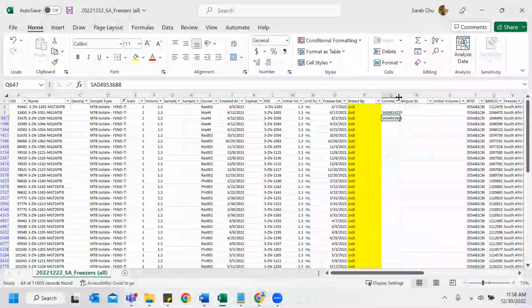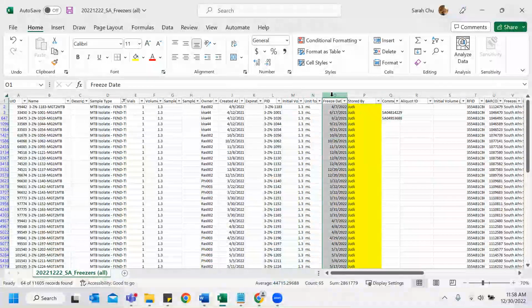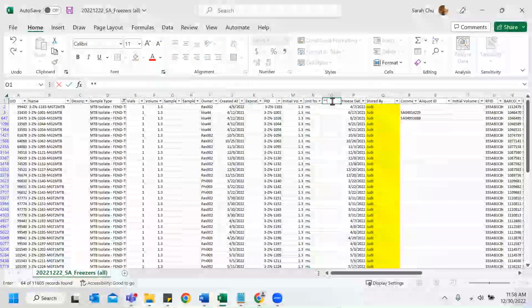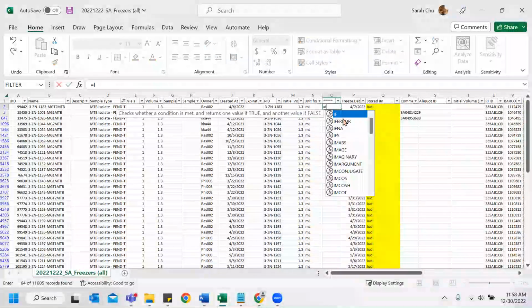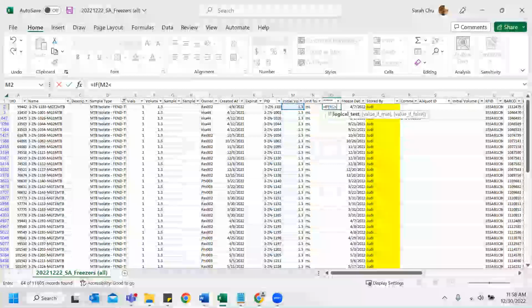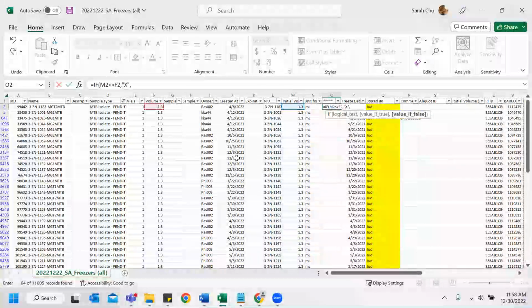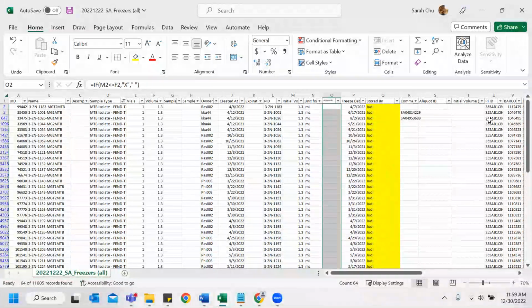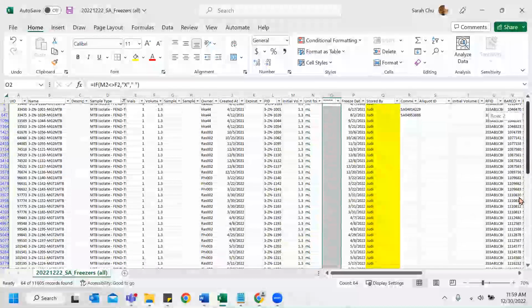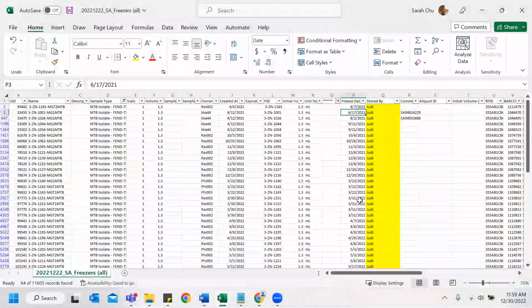And everything seems fine. So what we're going to do next is validating whether the volumes match. For my shortcut, since they're using this column, I'm going to temporarily add another column, adding asterisks as a reminder for me to delete it when I'm done. Formulas, if volume is less than or greater than, basically not equal to this, you put X, or you leave it blank if it's okay and equal to each other. And what I do is double click so it drags automatically. Is it dragged? Perfect. And then I just press this. There are no X's, so that means all the volumes are equal.